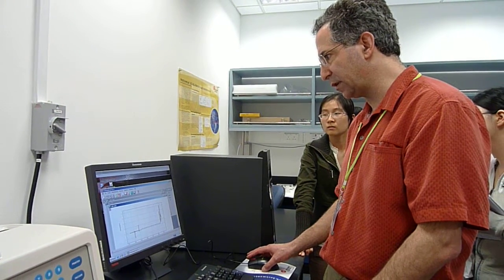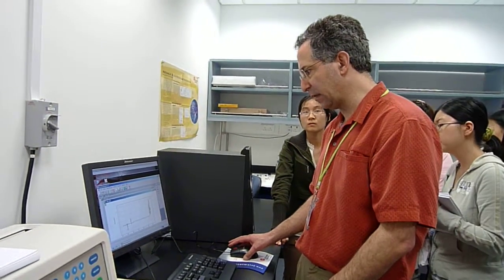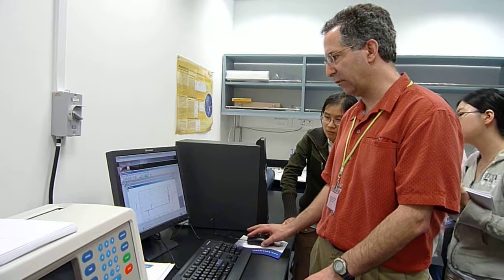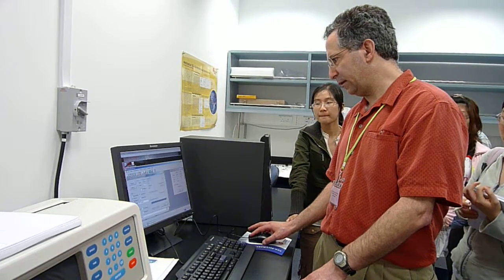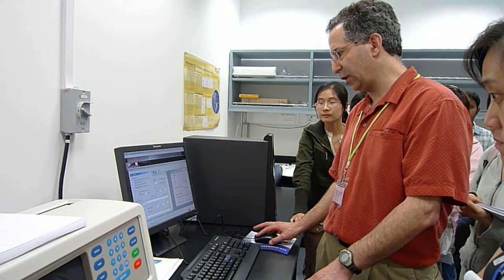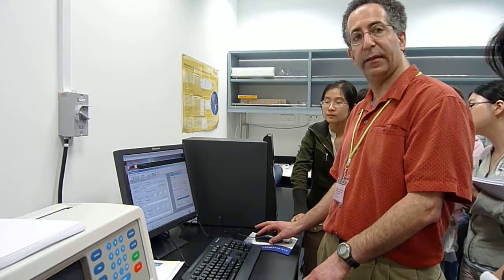The other thing we can do is just see if this is a slow leak or not. And honestly, this points to the importance of assembling cells clean, because you get many more leaks with velocity than you do with equilibrium. That's maybe one of the downsides. But certainly there are no catastrophes. What I'm ready to do now is change this option to stop it after the last run. And now we're going to start the method scan.